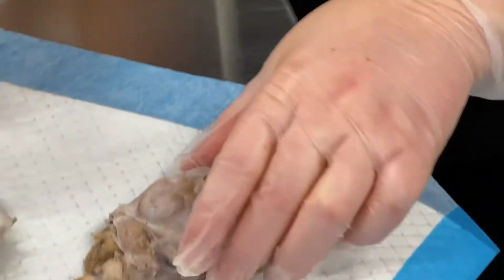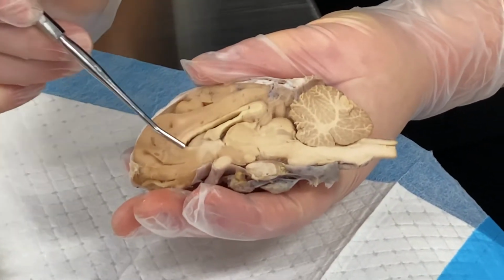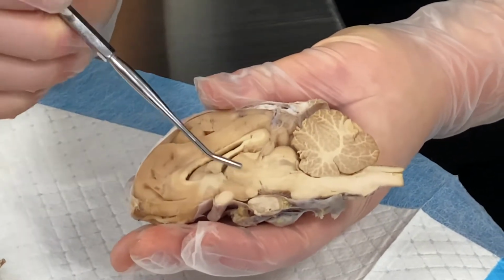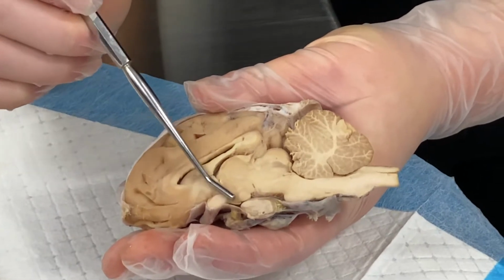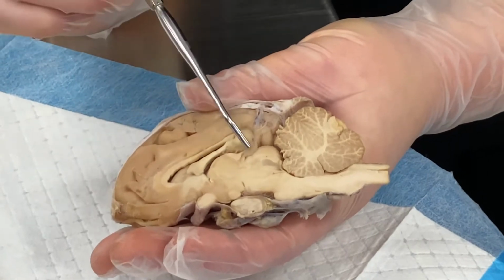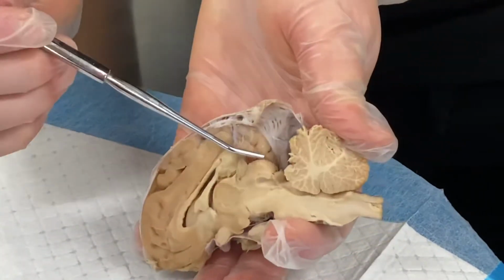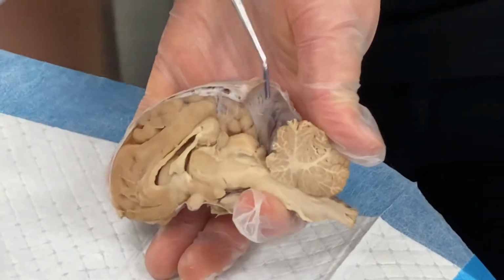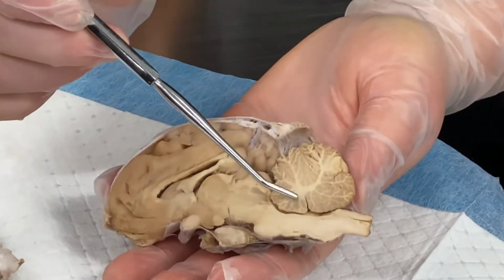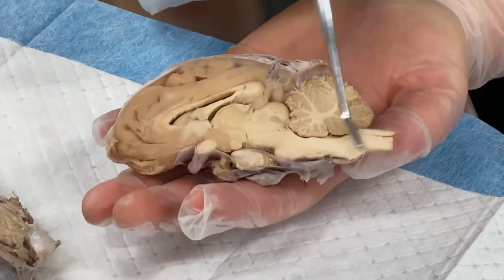Okay, then going on the inside, we have our corpus callosum. We have our thalamus, which is the circle right underneath it. Then underneath our thalamus, going forward, this area is called our hypothalamus. Behind our thalamus, we have our pineal gland, right there. Behind that is our superior colliculus, and then underneath that, we have our inferior colliculus. On our cerebellum here, this is called our arbor vitae, these little tree-like things. And then going back right in here, we're gonna talk about this.